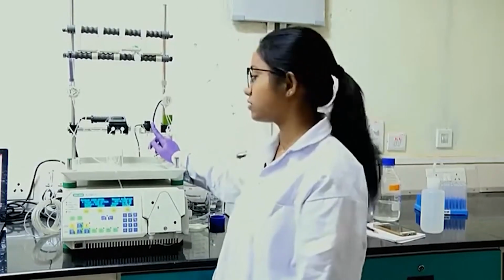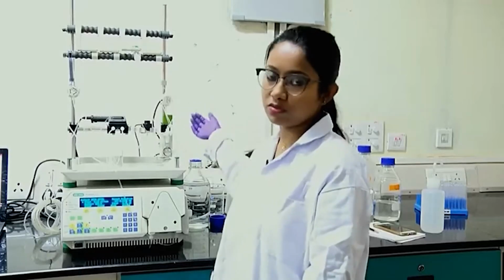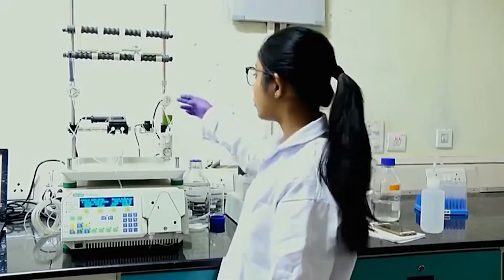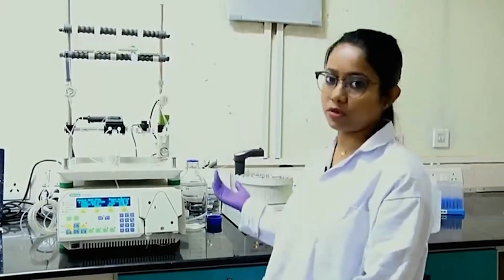It has a conductivity measurement instrument. So, it will get the conductivity of the solution, and then it will go out, and it might go to the bypass system or waste, which we will not collect. Or if you want to collect the flow through, you can go for this column collection, where it will be collected in the fraction collectors, which we will provide later.